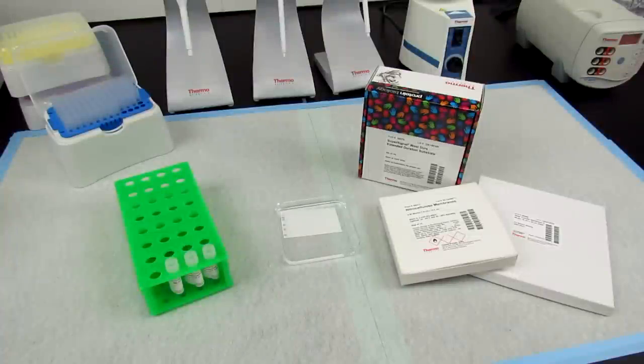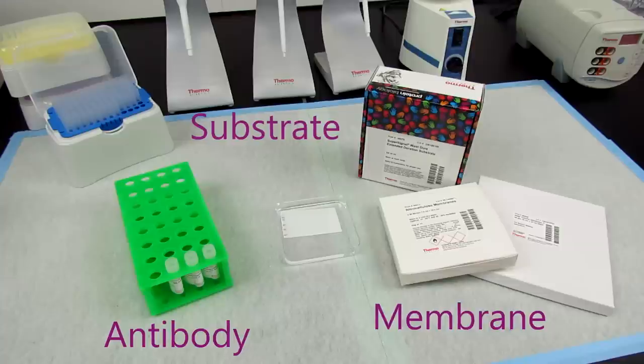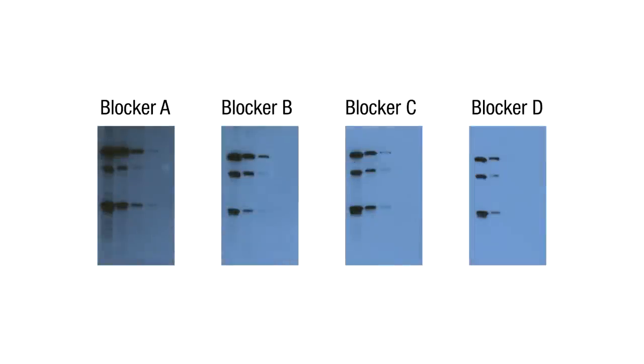The exact formulation and incubation period depends on the antibody, membrane type, and substrate system used. Identifying the formulation that yields the highest signal-to-noise ratio requires empirical testing.